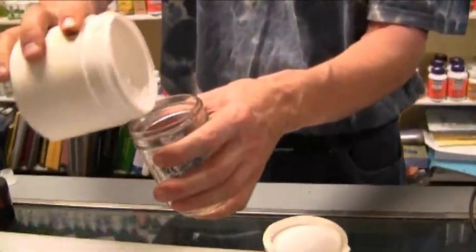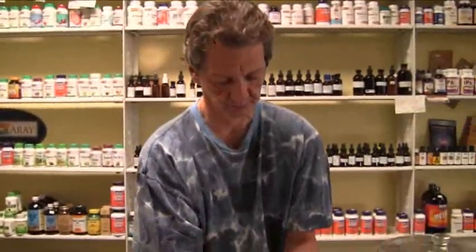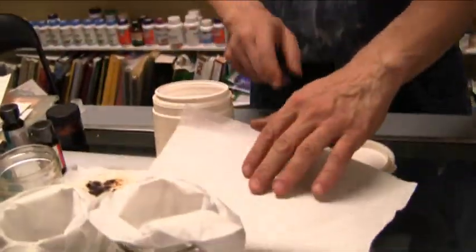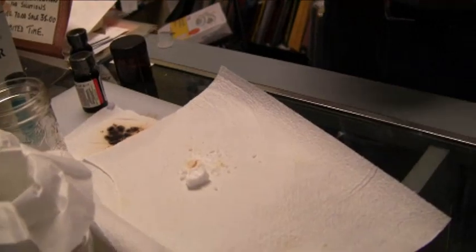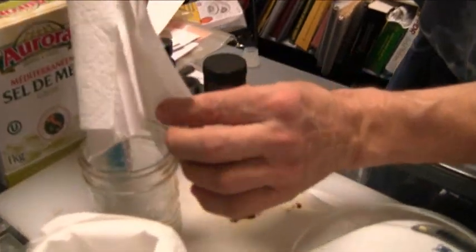We're going to pour some — they say about two grams — but it doesn't matter what volume you're using to get the crystals. We should weigh it out. I don't want to stain my equipment, so I'll do this on paper. Set it to zero with the paper, then measure it out. What we're pouring in is potassium iodide. I'm going to put eight grams in there. An iodide really, really absorbs in water, so we're pouring that in.